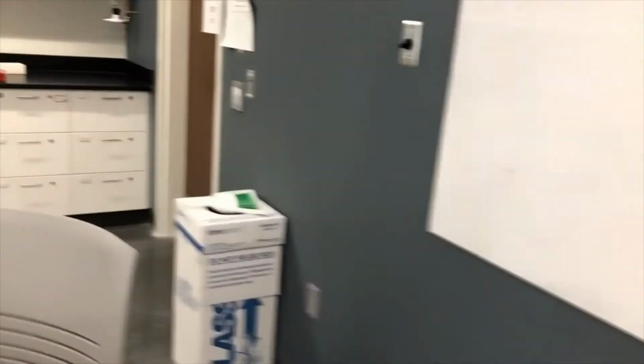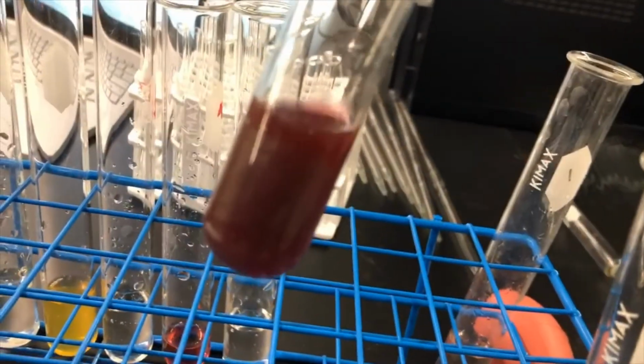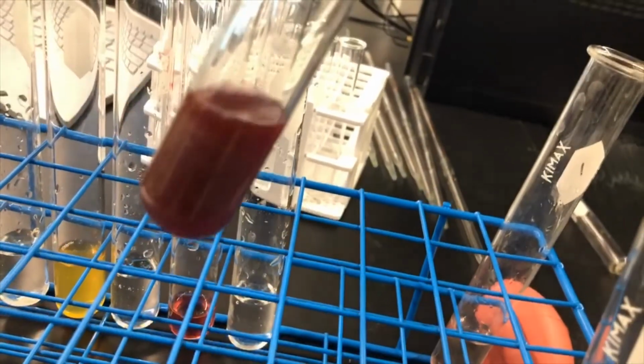So then just returning to these other guys, this is the solution with the copper, but as you can see, most of them stayed blank. The solution mixed with the iron sulfate turned yellow, which is interesting to know, and that turned yellow pretty much right away. And then that one with that silver nitrate, it turned this real deep burgundy color, and that happened more or less gradually over time.